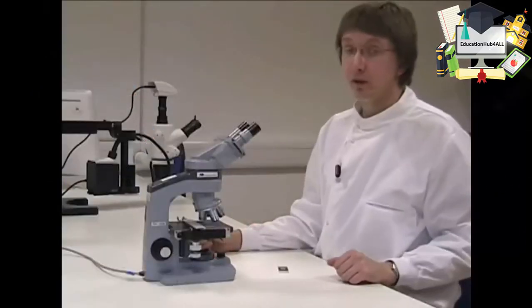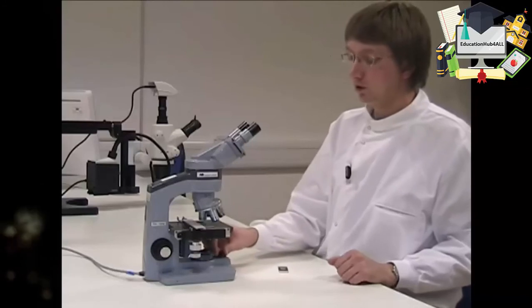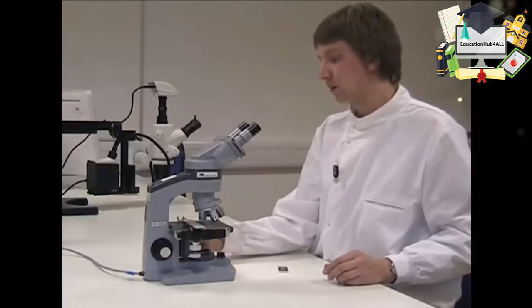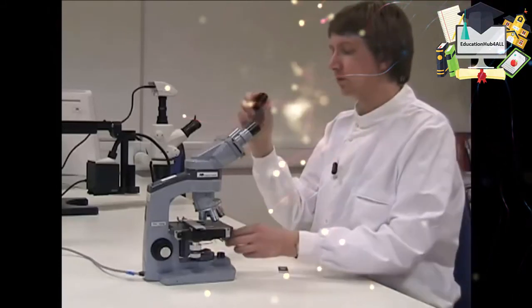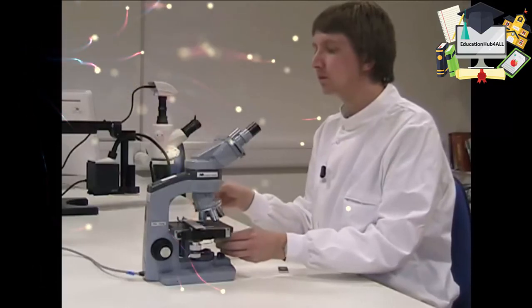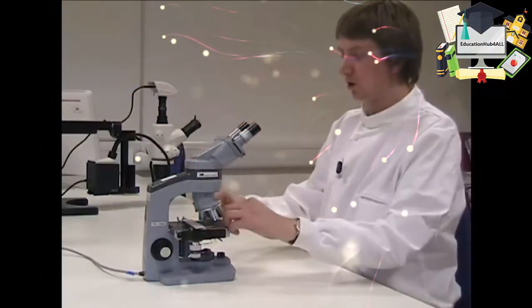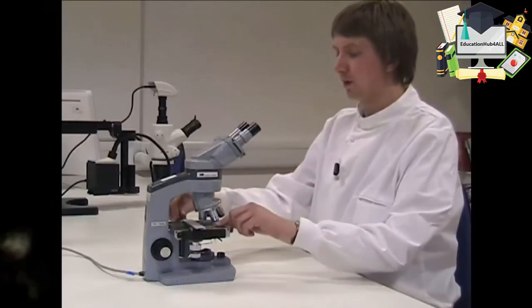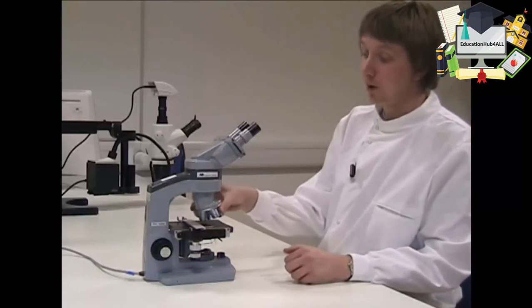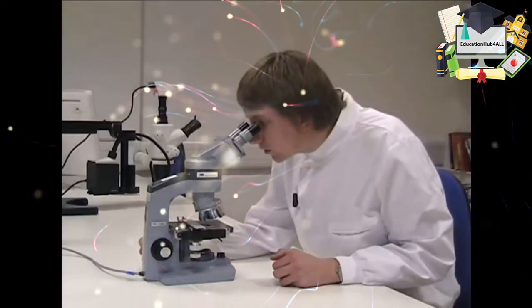So in summary then, everything you need to do to set up a light microscope: turn on the light source, adjust the condenser system to the appropriate height, put a slide on the stage and clip it into place, make sure you start off on a low power objective lens, focus the image, adjust the focus on the eyepiece.